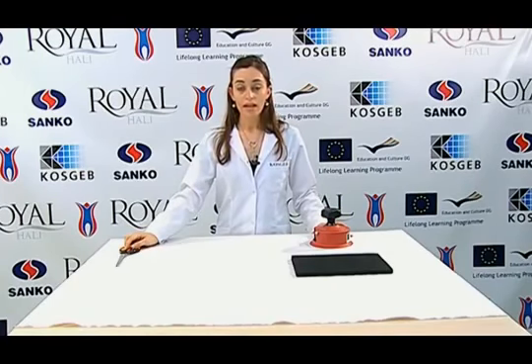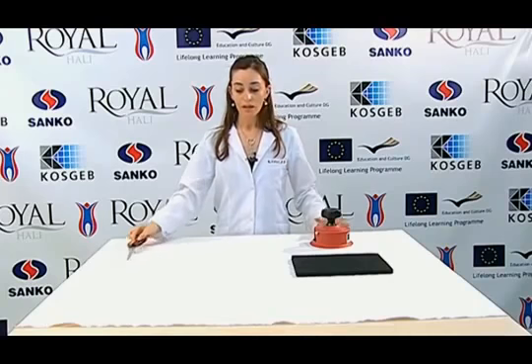The first thing to do when preparing the sample is to condition the sample under the standard atmospheric conditions for at least 24 hours. If the sample contains a wide pattern and the value affects the mass per unit, a number of samples to contain the whole pattern should be taken. Normally, the number of samples taken is 5 for the experiment.